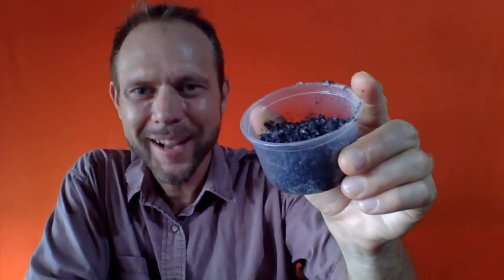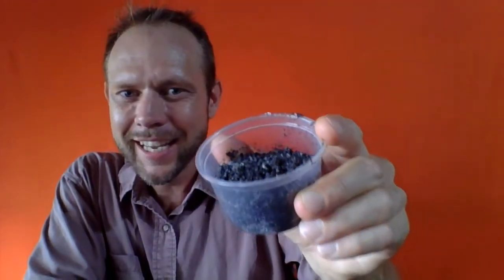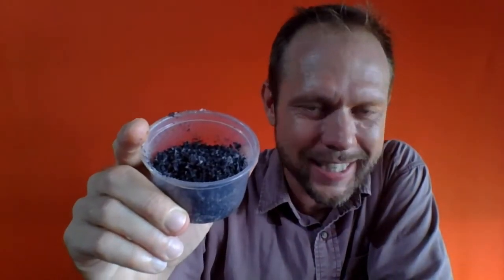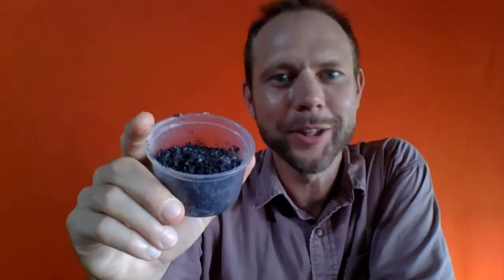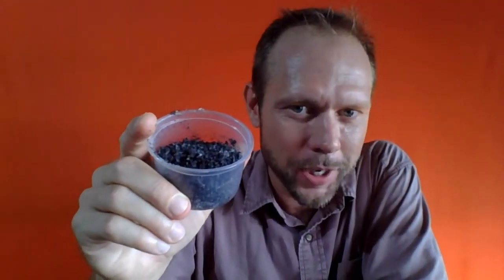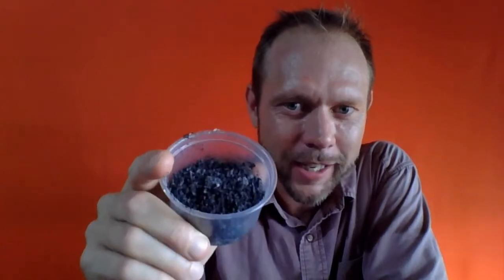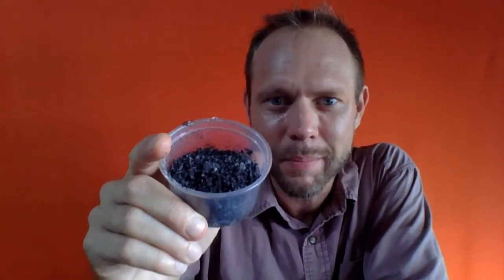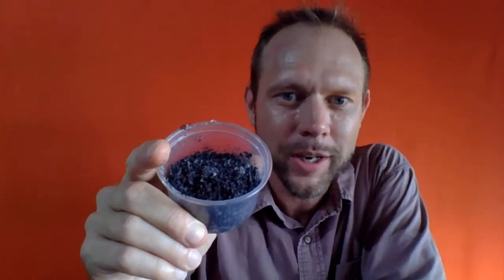So it was so easy to mix them. And so it's so easy to mix the sand and the salt to get a mixture. What we're going to look at is getting them back apart, making the separation, recovering pure sand, pure salt from this mixture. So how are we going to do it, and what measurements are we going to take so that we can determine if we make a good separation or not?